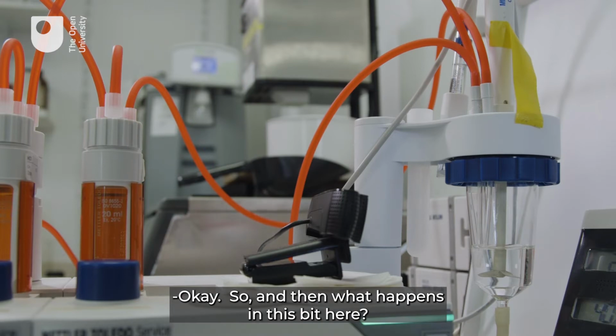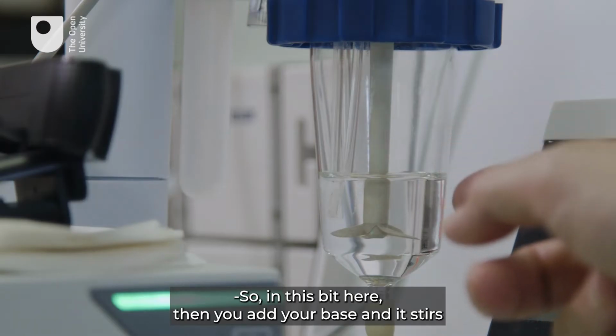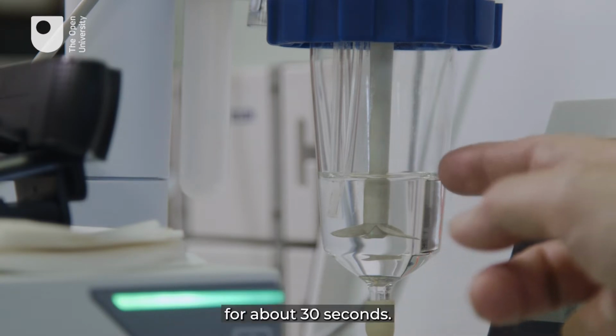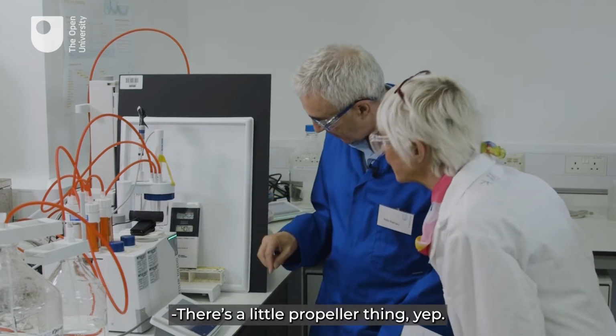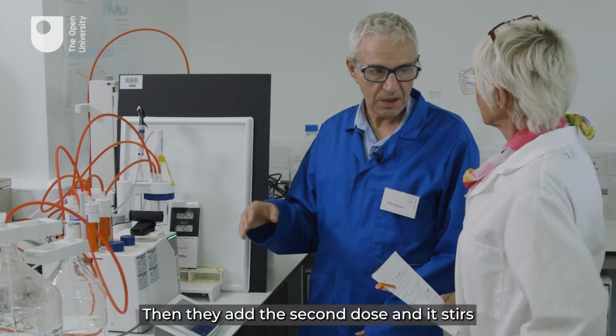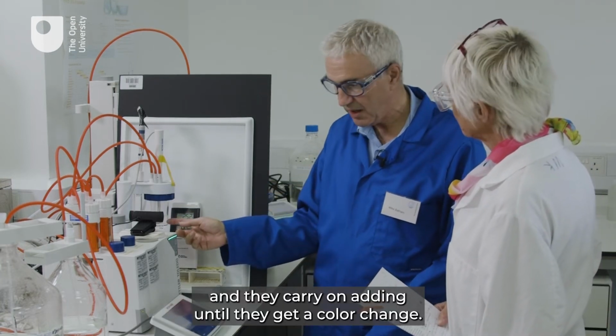Okay, and then what happens in this bit here? So in this bit here, you add your base and it stirs for about 30 seconds. Oh, it's a little propeller thing in there. Yep, a little propeller thing, and it stirs for 30 seconds. Then they add the second dose and it stirs, and they carry on adding until they get a colour change.